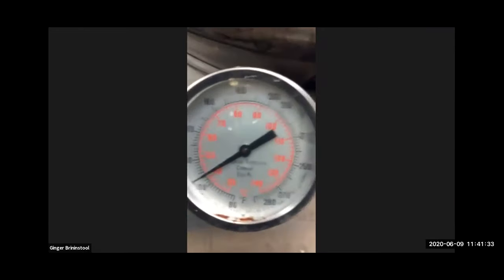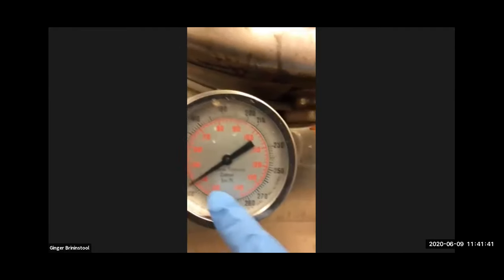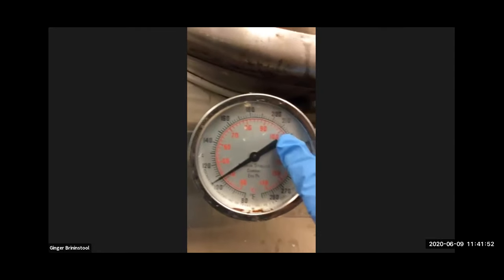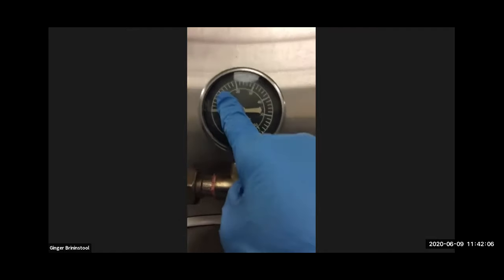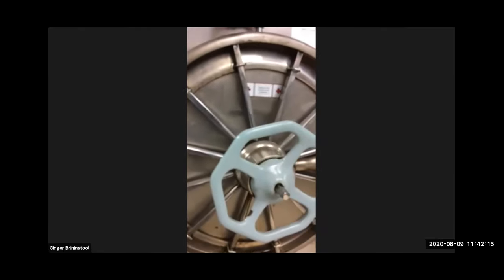If we go down, we'll see a temperature gauge, and we follow the red gauge. So hopefully that's pretty clear to you guys. If we look at it right now, it's pretty chill, 42 degrees Celsius. When we turn it on, it's going to go up past 100 degrees Celsius, past 120 degrees Celsius to 121. And we need it to be at 121 degrees Celsius and 15 pounds per square inch of pressure in order to sterilize the media. So I put in the media from the last class, and it's sterilized and it's cooled down now. So it's ready to come out. I'm going to show you how to go about that.